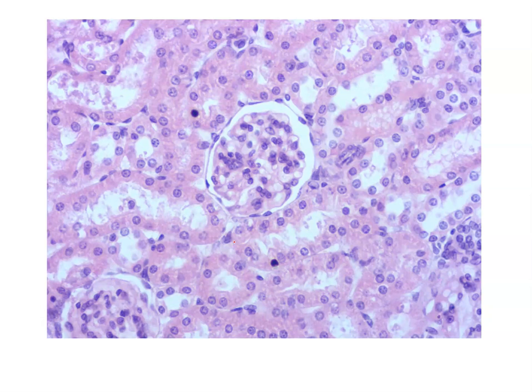We have our flat or disc or pierogi shape or ravioli shape. That is a squamous epithelium. A cube-shaped epithelium, we say it's cuboidal. And if we have cells that are taller than they are wide, we say that it is a columnar type epithelium. So here we have our kidney slide, and there are 2 types of epithelium that are represented.